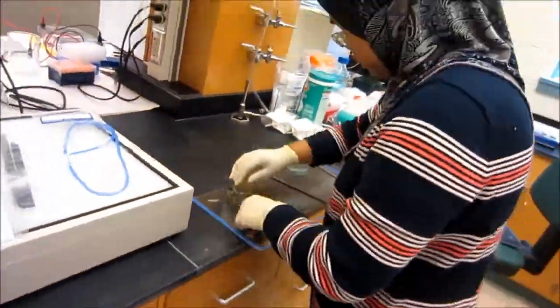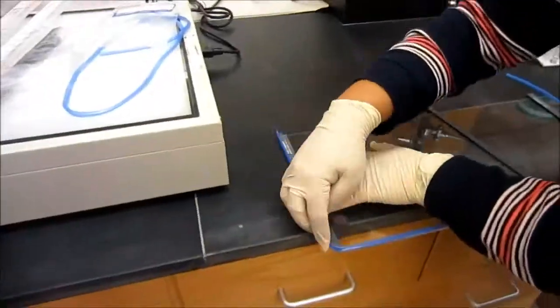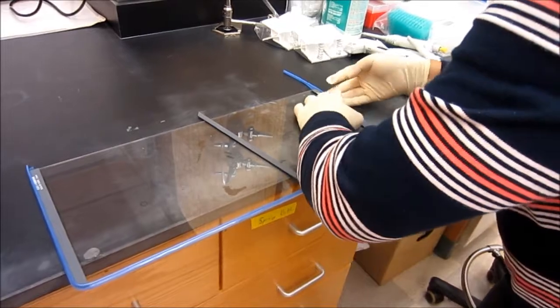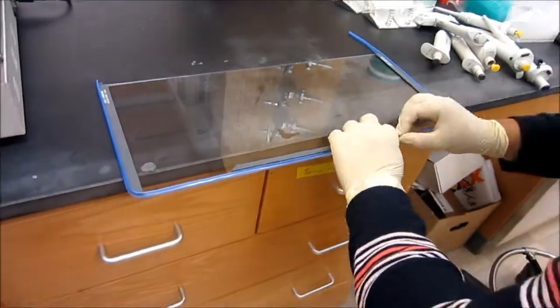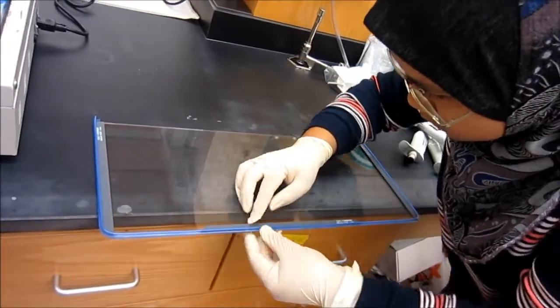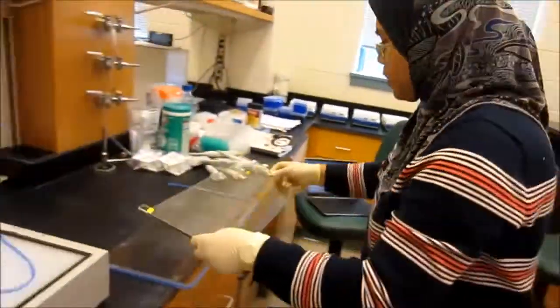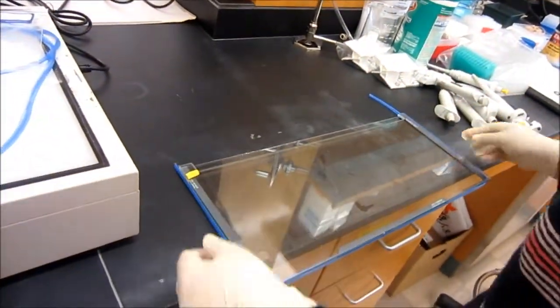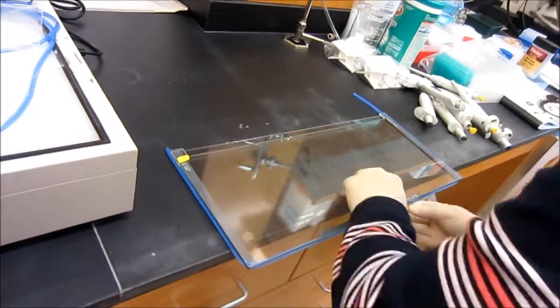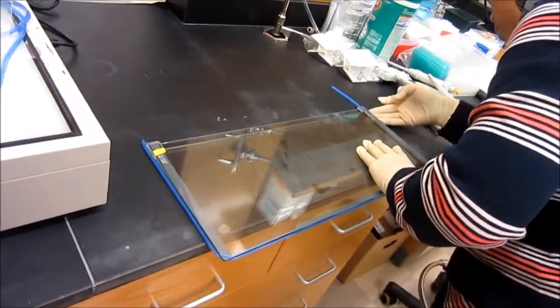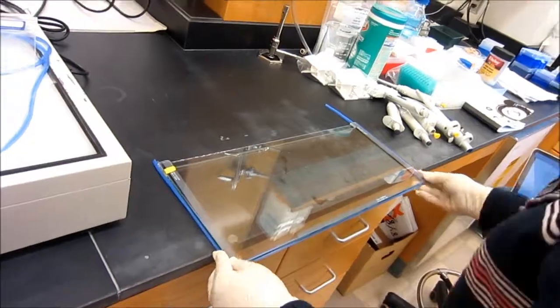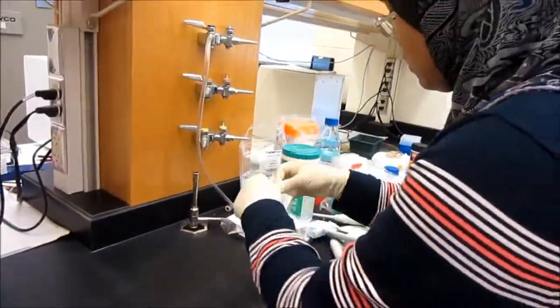After that, spacers are placed at glass sides and its bottom. A notch glass slide that has a space for comb is then carefully placed on top of the first glass. White clamps are used to attach these two glasses together.